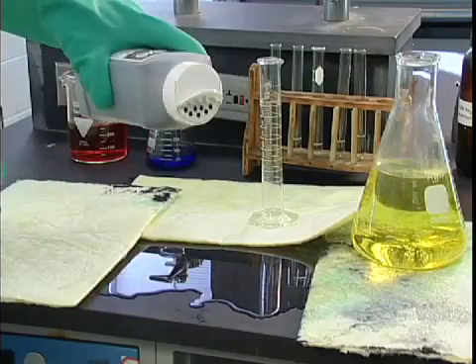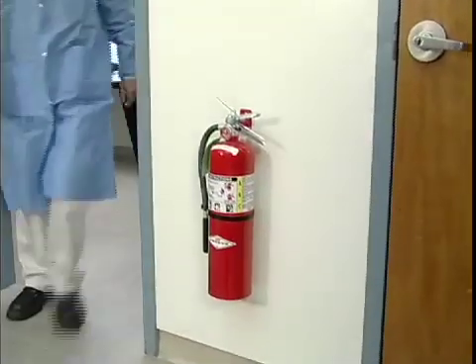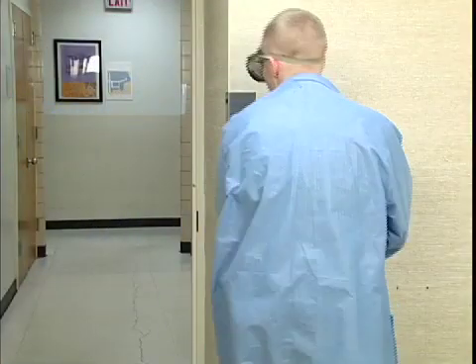This means how to clean up a toxic substance to limit the effects of a spill, or pulling a fire extinguisher off the wall to combat a fire. Or it may simply mean sounding an alarm and leaving the area as quickly as possible.